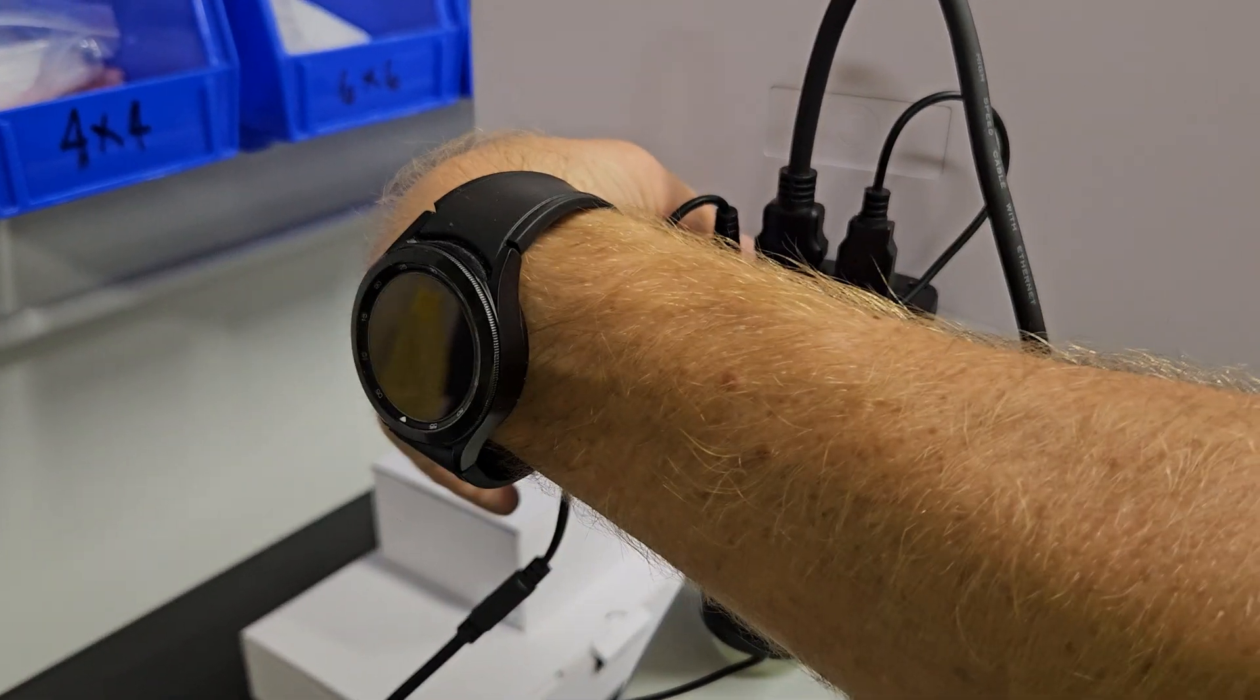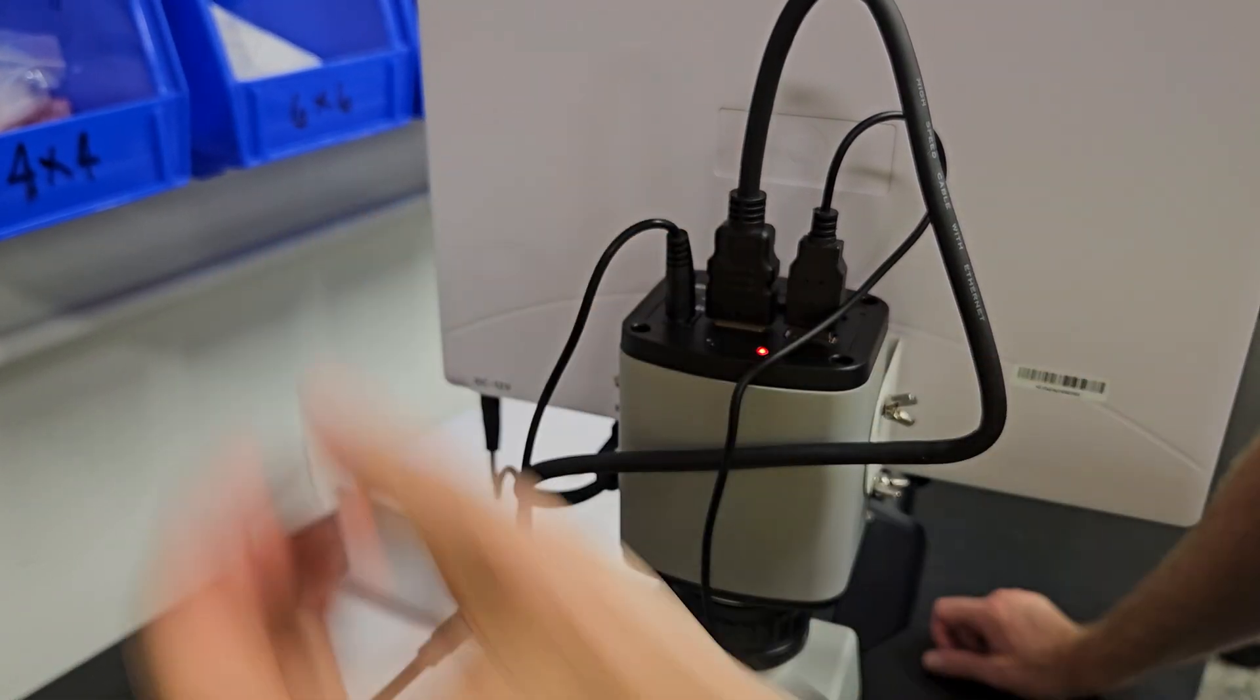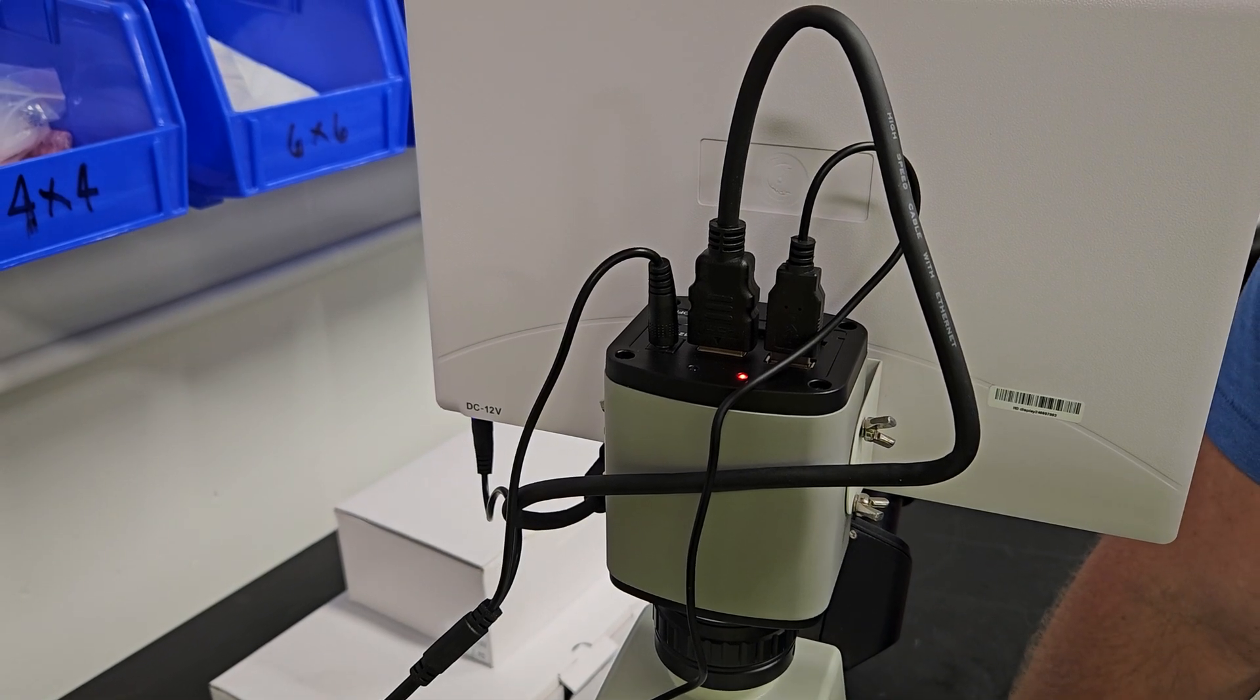Whenever there's no power that blue light will not be on. So whenever you turn it on the blue light will go on. It takes just a second and it'll come right on. There it goes.